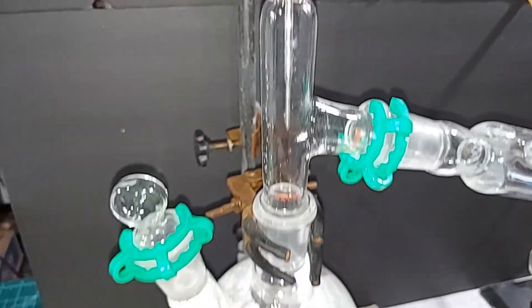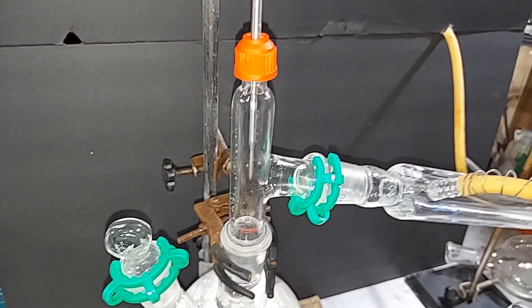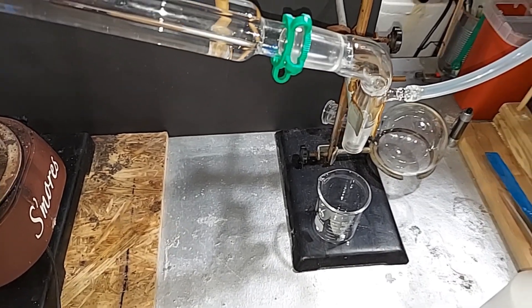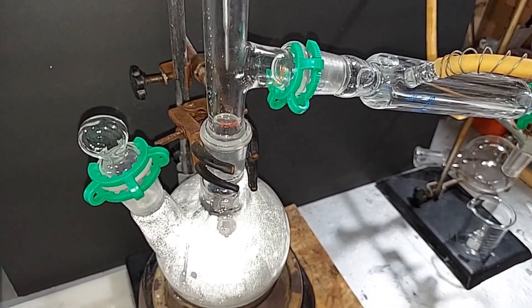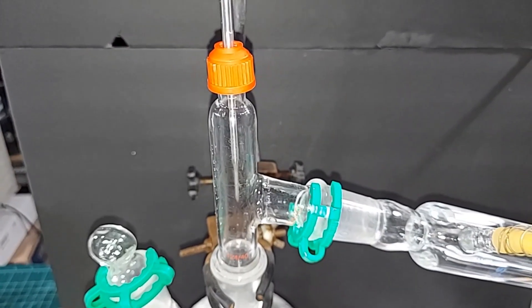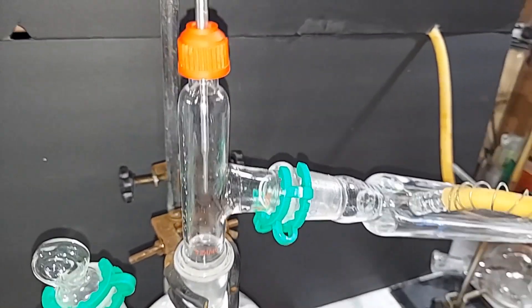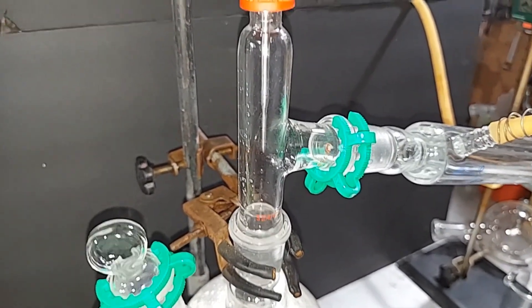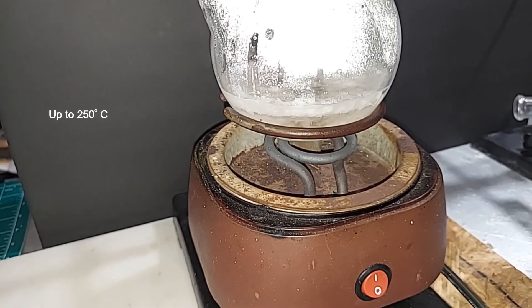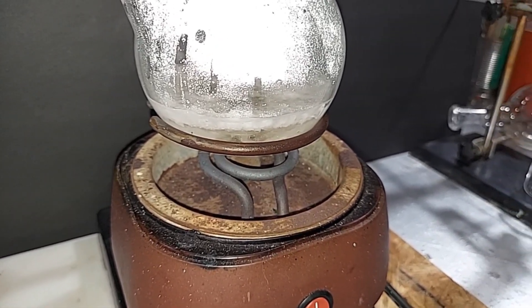The thermometer is in place. I'll collect everything up to 115°C in the 100 mL beaker — any extra water will come over there — and once it hits 115°C the acetic acid coming over should be pure and glacial. I note that this is a stainless steel thermometer; I've tested it in hot sulfuric and nitric acids and it shows no pitting. If I keep the hot plate around 200°C, I'll bring over only acetic acid, since the boiling points of sulfuric acid and sodium sulfate are much higher.